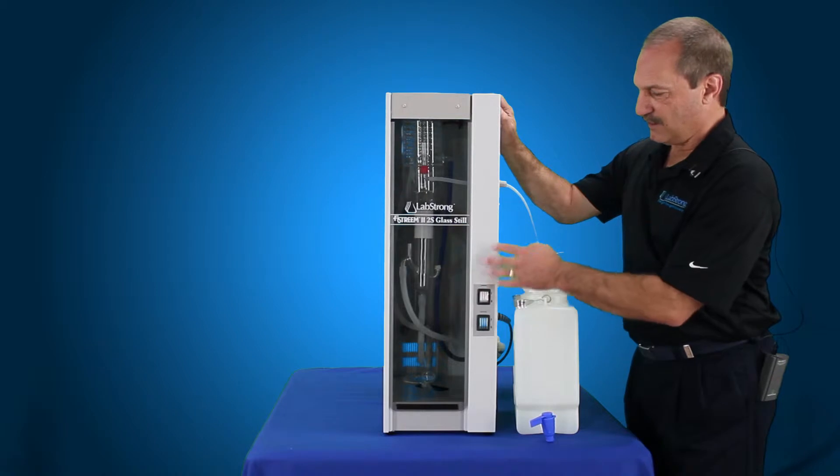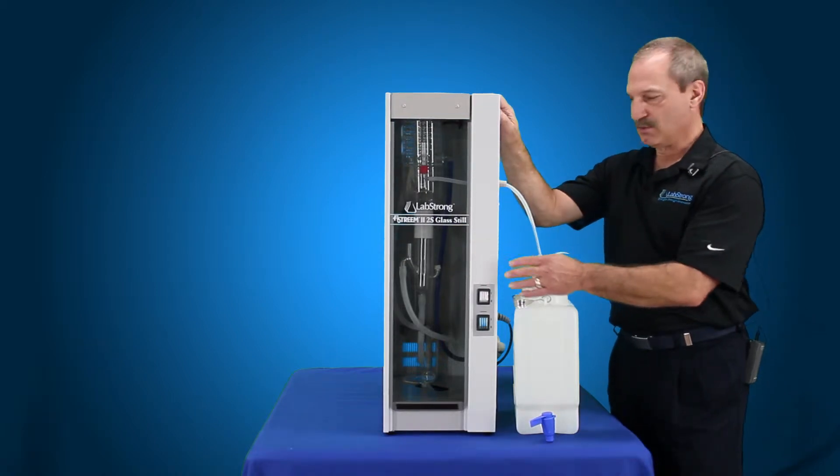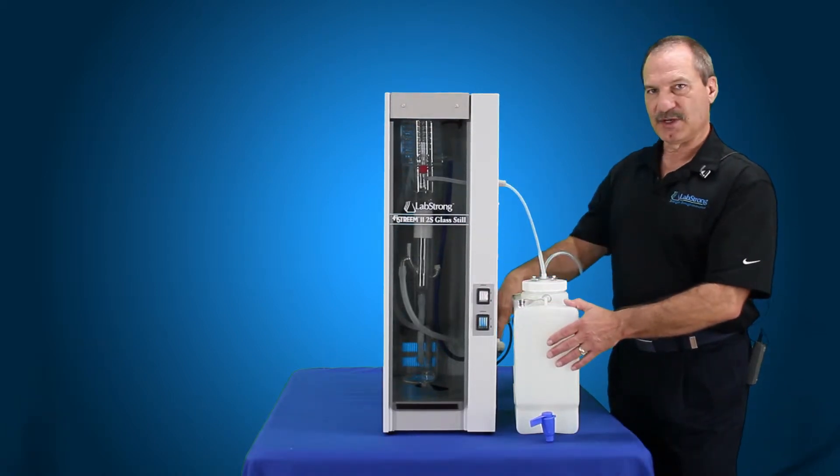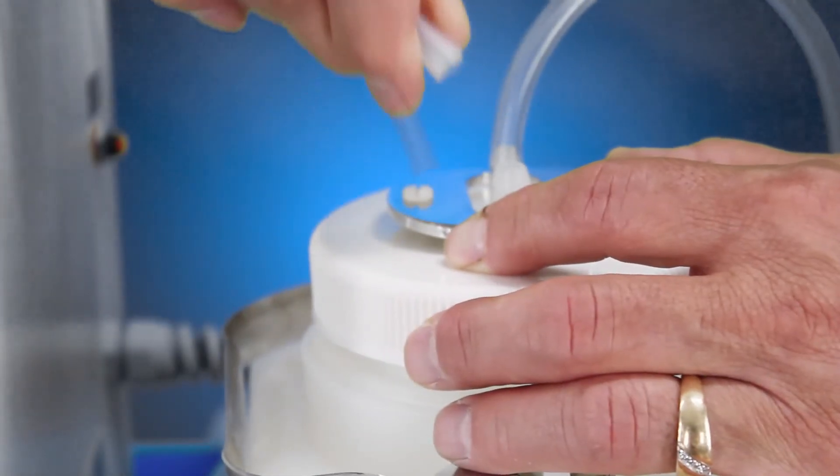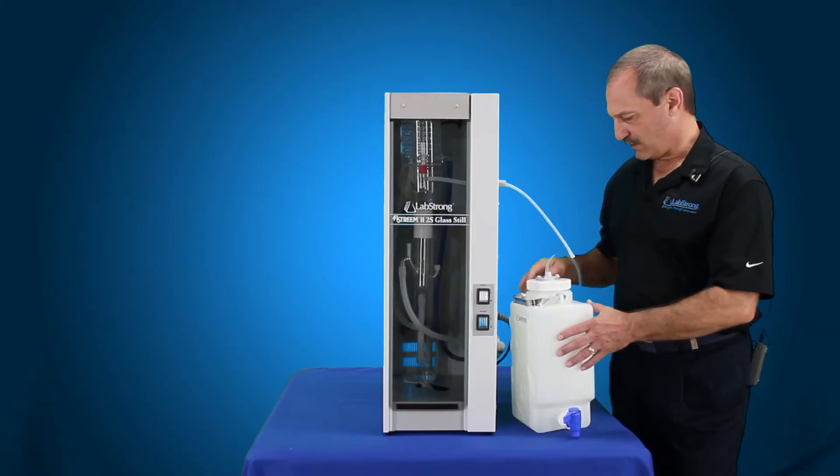Once you've done that, you can actually leave the system connected up to the inlet water and to your drain because you're going to need that. You want to disconnect your tank because you don't want this going to the tank at all.